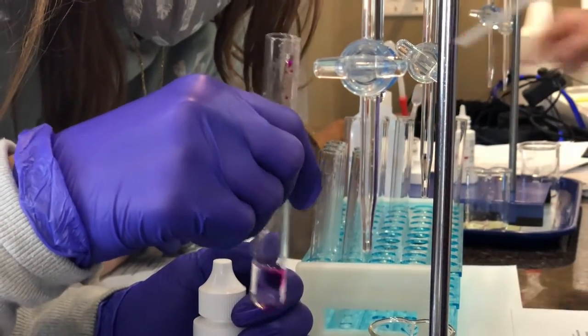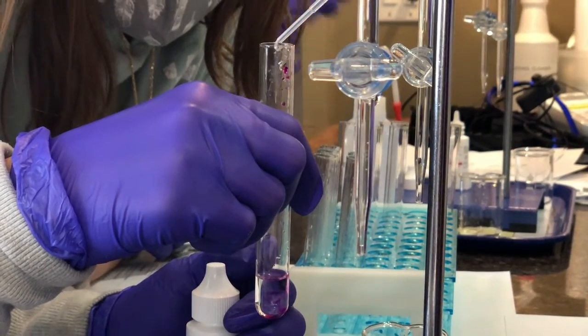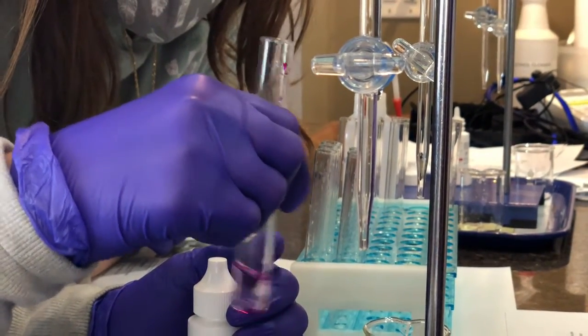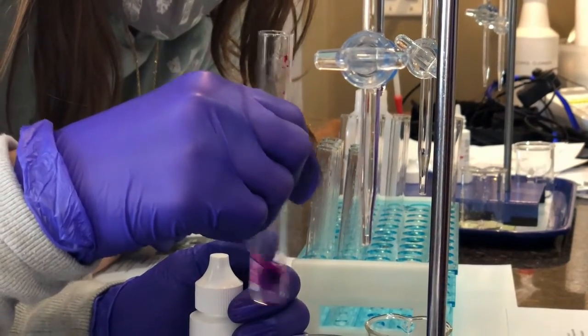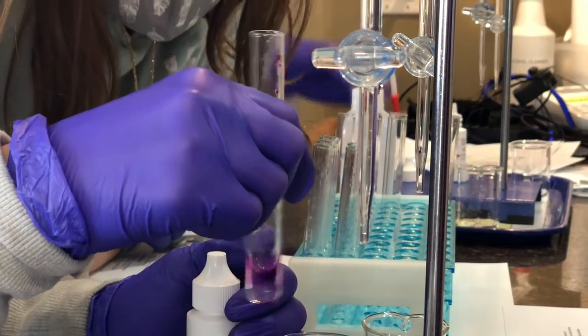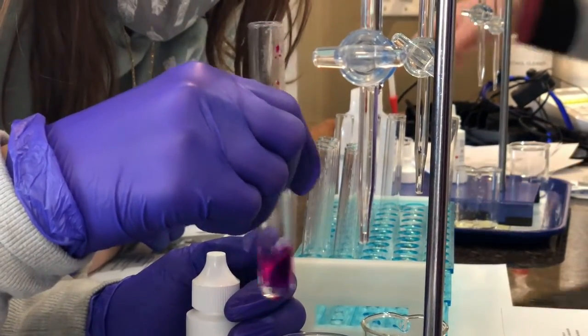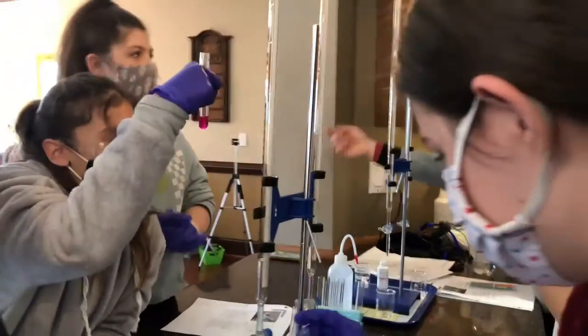Put it in there. Give it a good vigorous shake. There you go. I think that's good. Just so that there's something. Literally nothing. No, we're good. No. Look at it. It's not there yet. Yes, it is. No, it's not. Yes, it is. We're looking at the bottom. That's what I've been measuring. Oh, you did it! There you go. Nice.